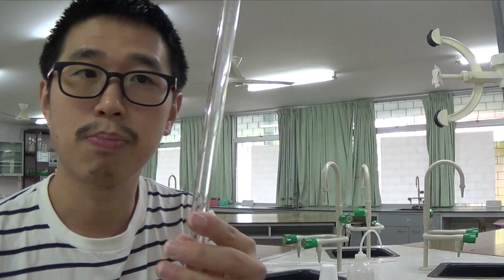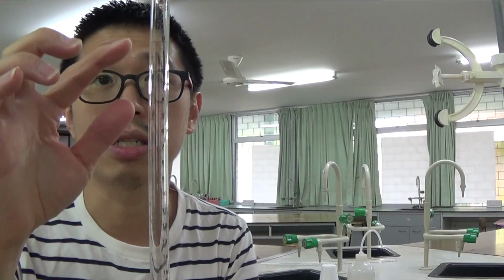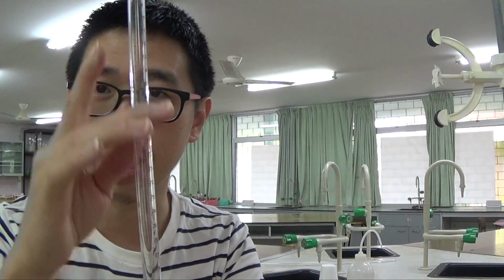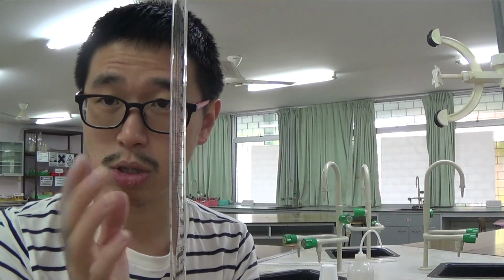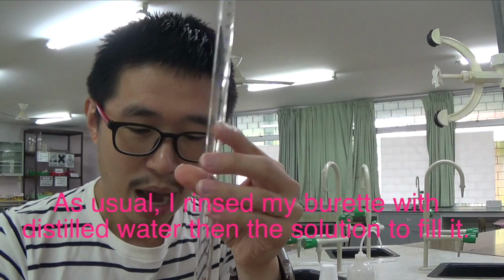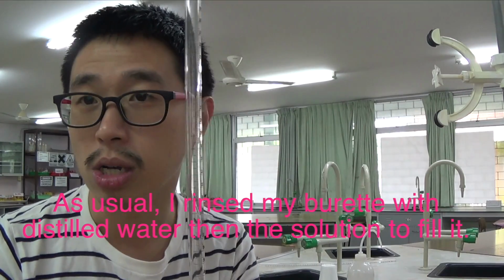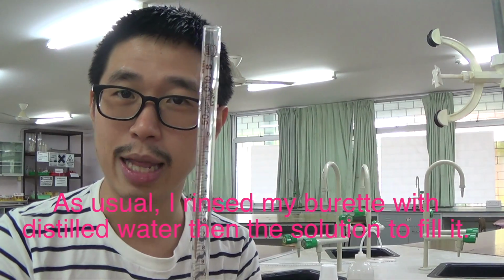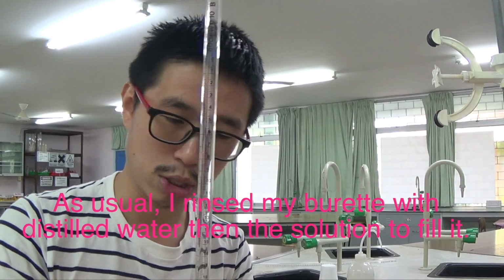This is a burette, B-U-R-E-T-T-E. You know this runs from 0 to 50.0, 1 decimal place for O-level and IGCSE level. But of course, if you are A-level students, you know that you need to do burette reading to 2 decimal places. I'm just going to focus on the 1 decimal place because I am specifically preparing this tutorial video for the O-level and IGCSE level 14 to 16 years old chemistry students.